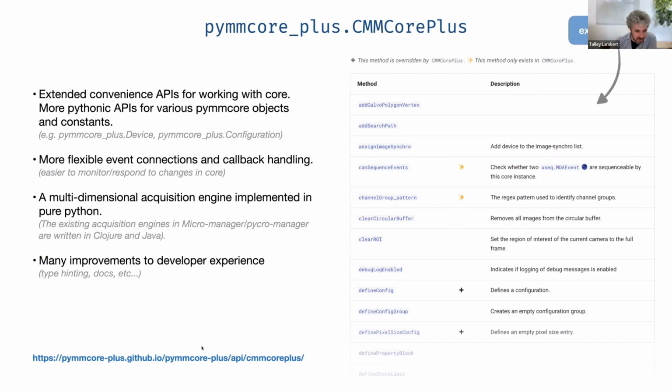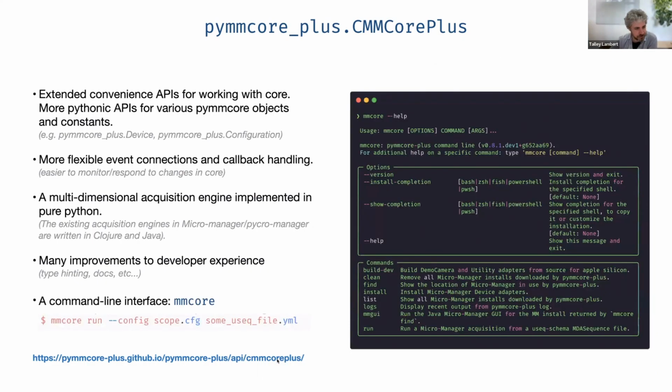So the docs that are linked here, there's a big page that shows you, I think it's even easier to look through this than the CMMCore docs themselves, but you'll also see a plus sign where we have overridden the native implementation to customize the behavior a little bit, to improve it. And there will be an explanation as to why we overrode it, or you might see a little sparkle emoji, which means that this is something that only exists in CMMCorePlus. So we have added a couple things and we've overridden a couple things, and they're all clearly delineated on this page.